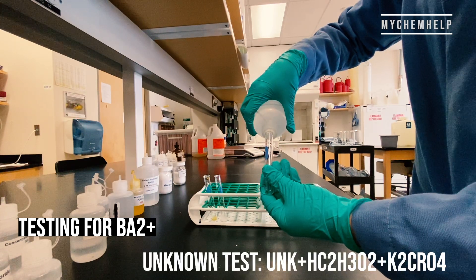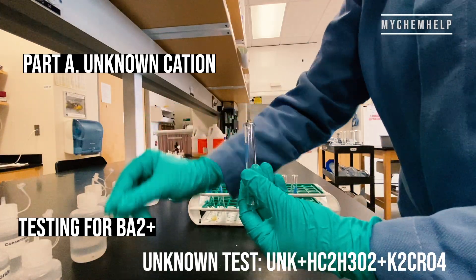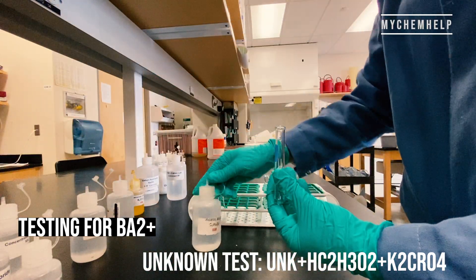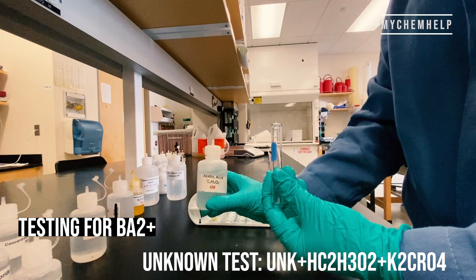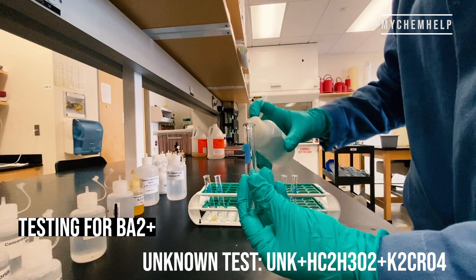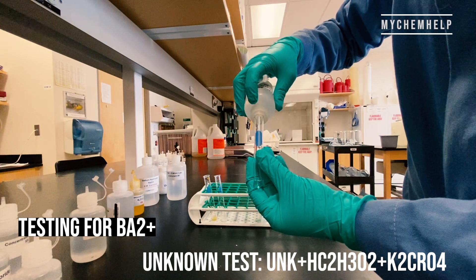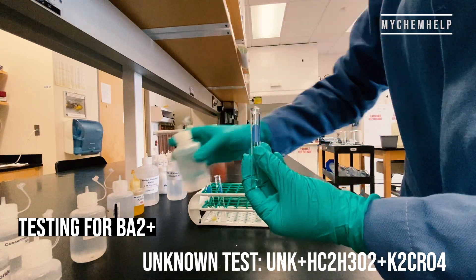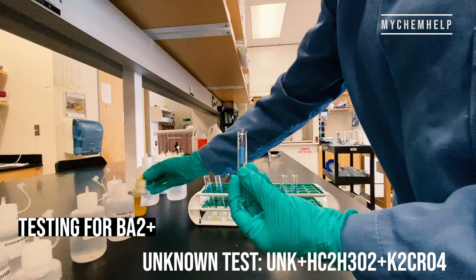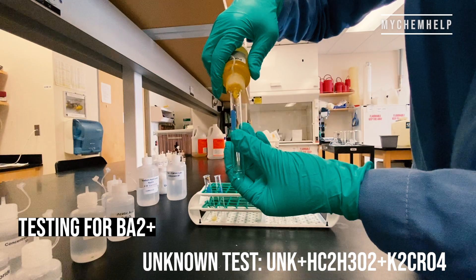So this is actually an unknown. I'm going to be testing an unknown along with all of our cation and anion tests, and you guys can follow along and see what you think the unknown is and draw your own conclusions. Into this test tube I've added some of the unknown, a bit of acetic acid, and potassium chromate as we did in the known test.